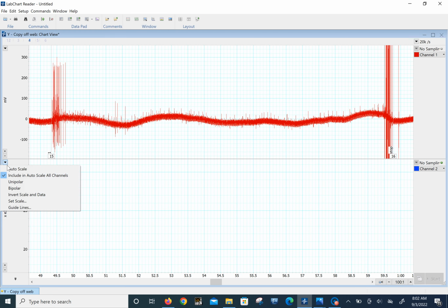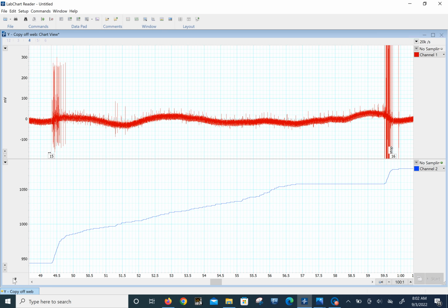And let's see what it does this time. Let's move the marker over here at the beginning. Go 10 seconds over. And here we are at 10 seconds, and we get 114. So you see the difference of having to change the standard deviation to make sure we can still count these spikes, but not all the noise in there.